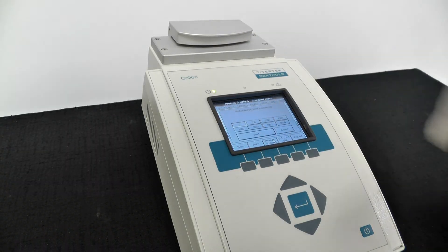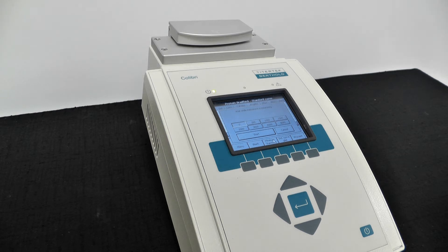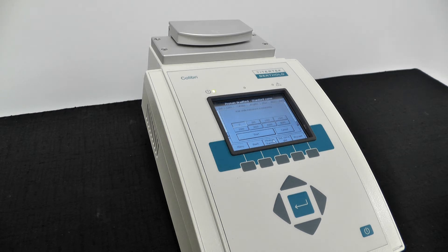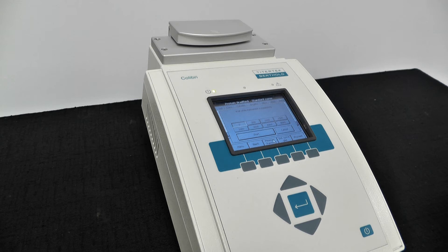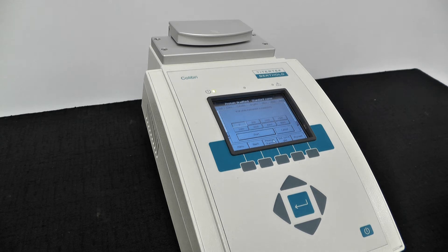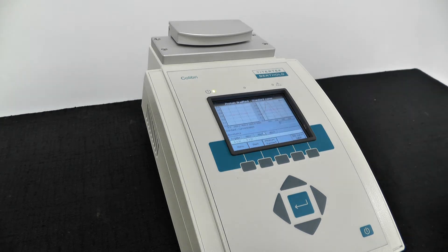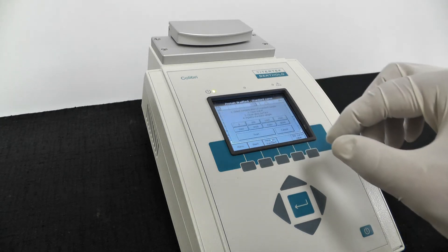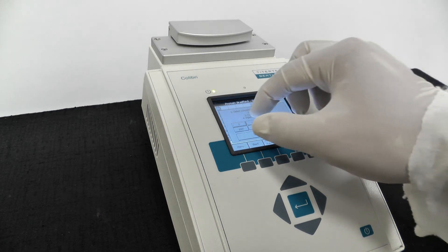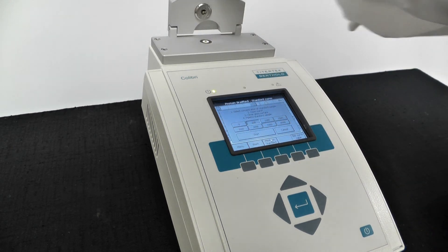Wait while the instrument measures your reference. The absorbance of your reference is displayed. Click Measure Standard to continue measuring the rest of your standards.